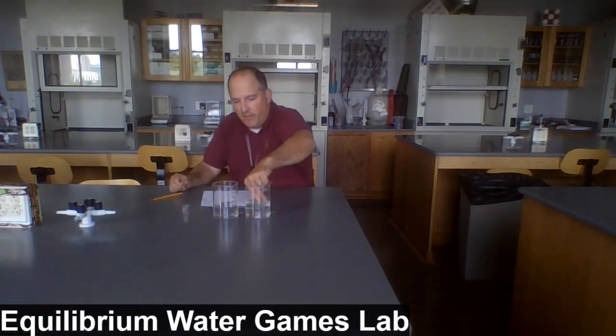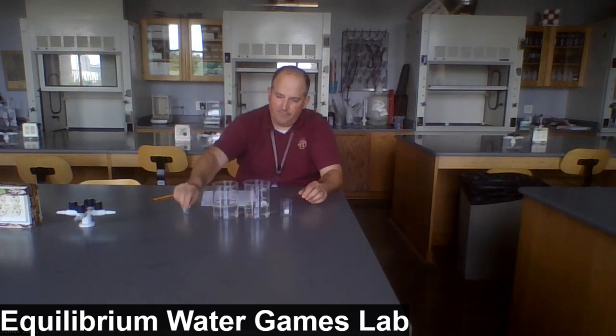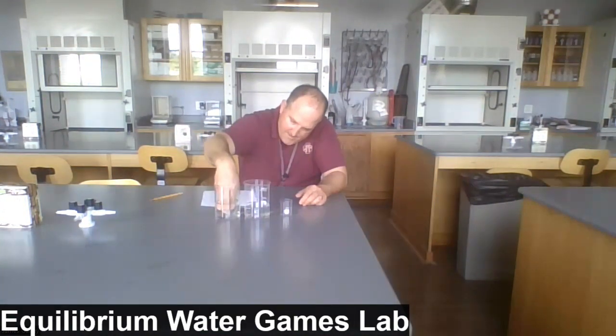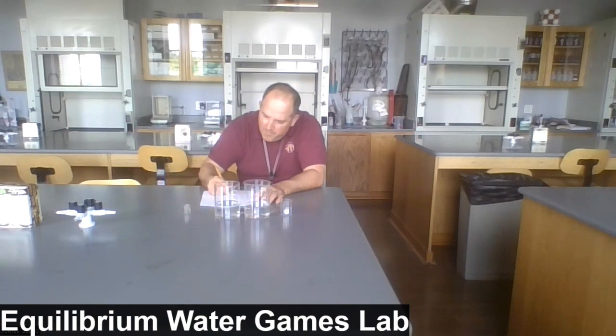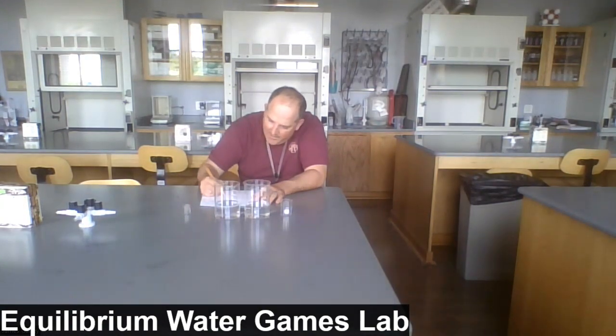Now we'll do transfer cycle 6. Oops. Okay. After 6, I've got 240 in beaker A and 280 in beaker B.